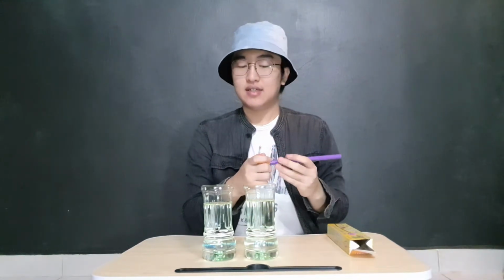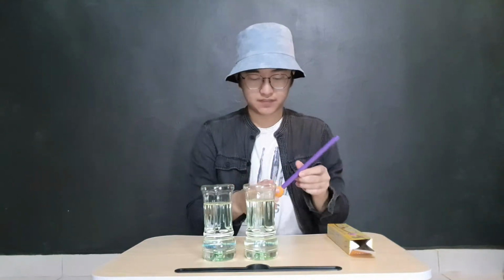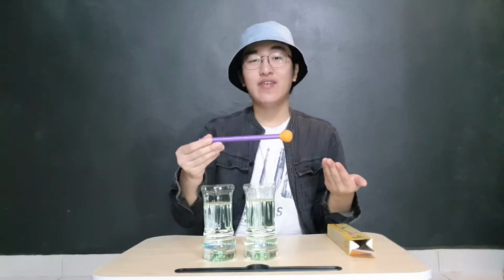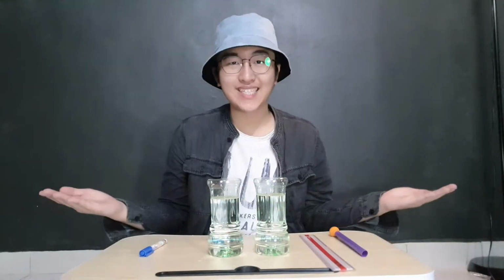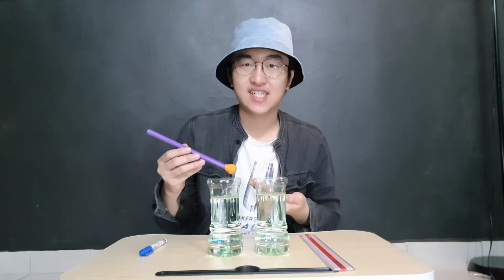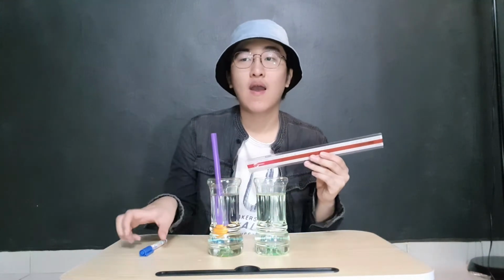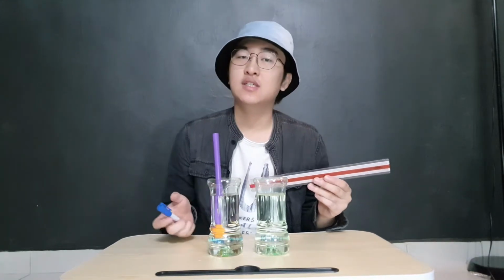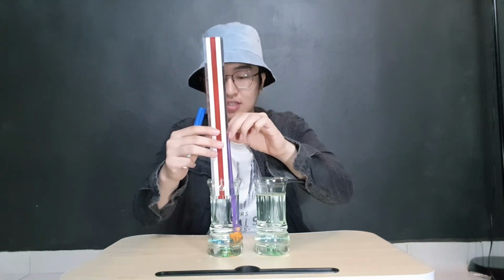And let me reshape the modeling clay to a more balanced and compact form. And yes, now you have a DIY salinometer. Next, you need to prepare your salinometer and adjust the size of the modeling clay so that when it is put inside the solution, it floats naturally without touching the walls of the container. So next, let us place the salinometer into the water and measure using a ruler and mark the point of the surface of the water using a marker pen. Make sure you straighten and calibrate the salinometer before you do the marking.